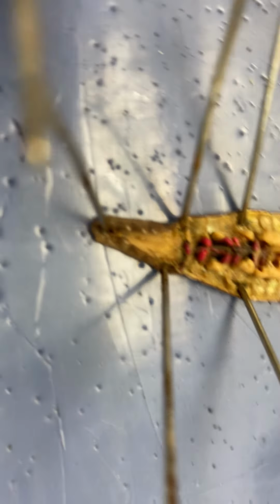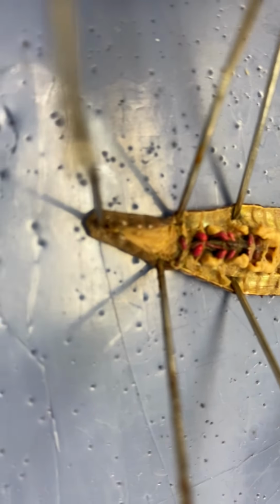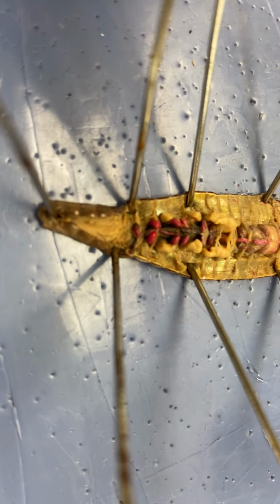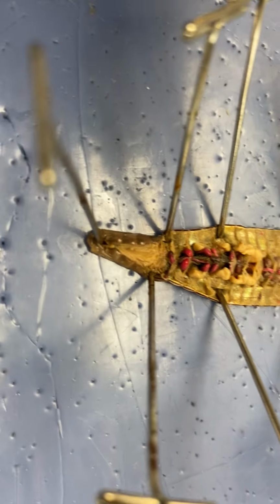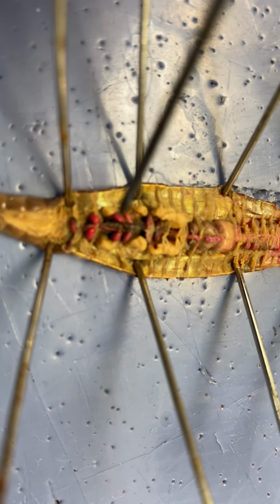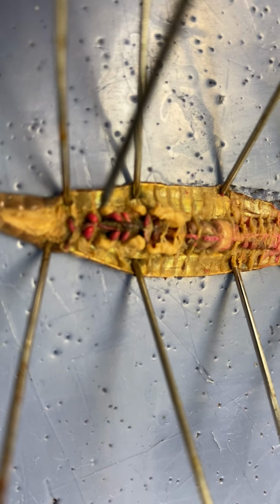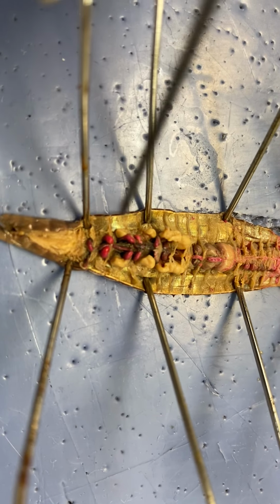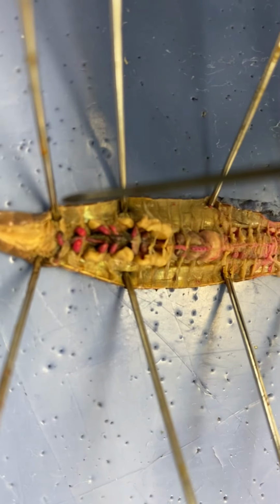And it's going to be hard seeing the esophagus because it's located under these structures. I'm lucky on the container that I opened. These earthworms are actually dyed with some latex, unlike the ones I opened up last year. So you can actually see things a lot better. So all these little red things are in pairs. Those are the aortic arches, which is the heart, part of the circulatory system that pumps blood.